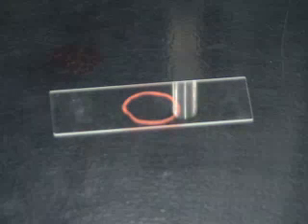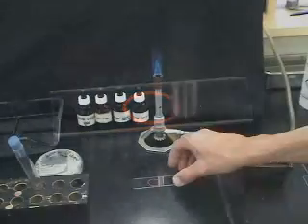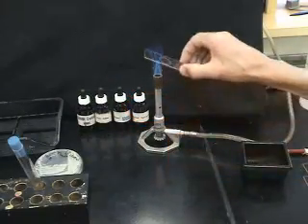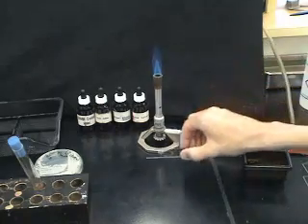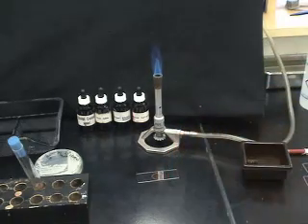Once dry, the smear is briefly passed through a flame. This melts exopolysaccharide on the surface of the cells, cementing them to the glass. The slide should be passed through the flame for about one half second. Doing it any longer than that can result in poor slides.